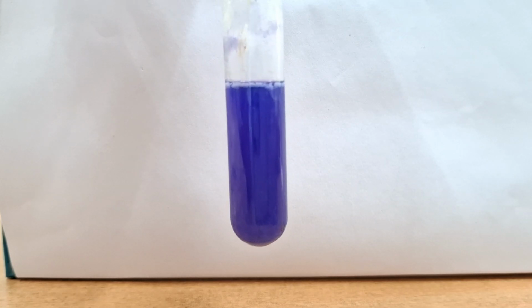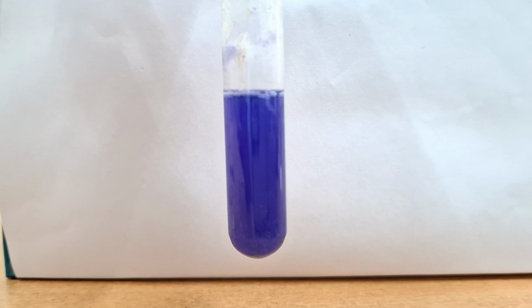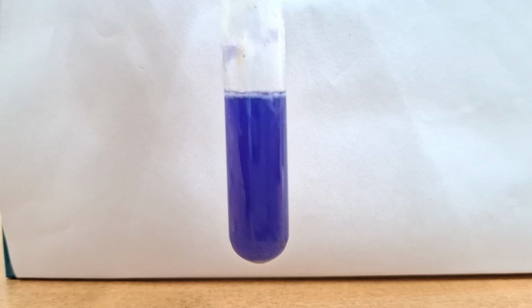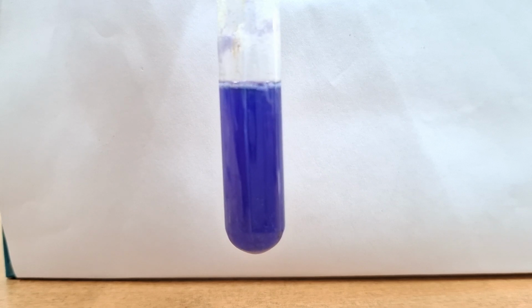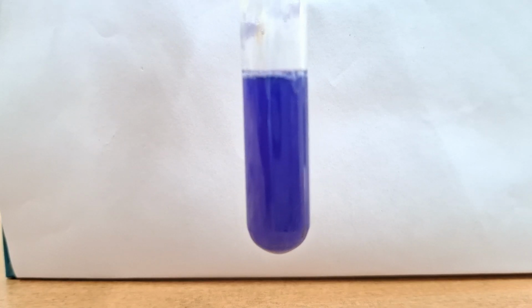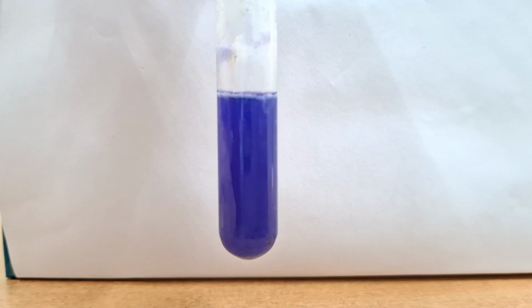What is the principle? You know ninhydrin is a powerful oxidizing agent. You have to answer this in a viva. When the examiner asks you to tell the principle of the ninhydrin test, you have to add this. Ninhydrin is a powerful oxidizing agent and causes oxidative decarboxylation of free alpha amino acids, producing aldehyde and ammonia.